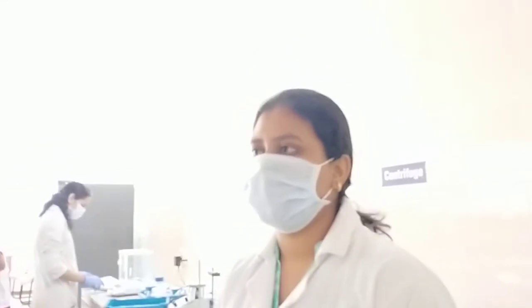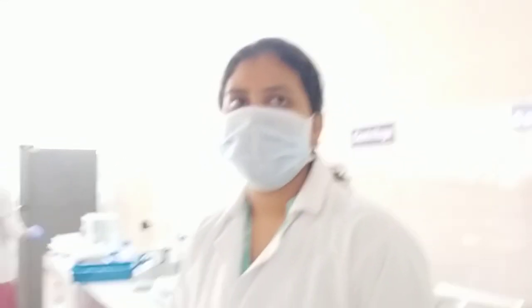We can use NaOH or HCl, anything. Okay. So what is the best pH? The best pH condition is 5.